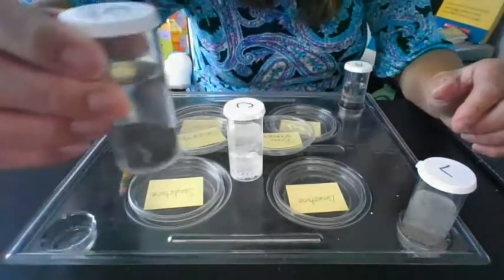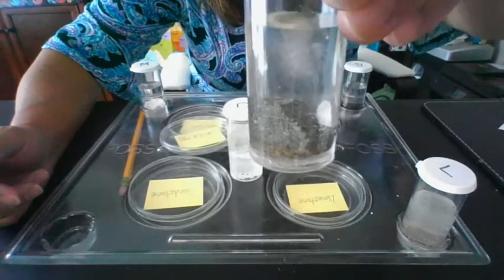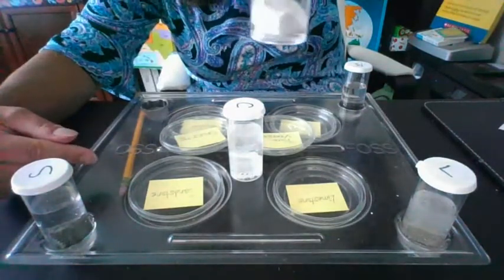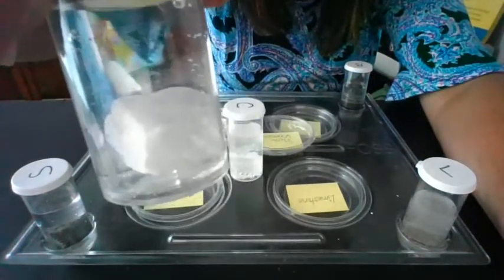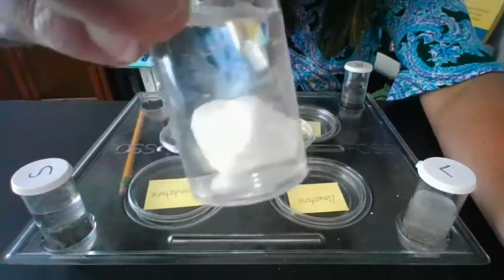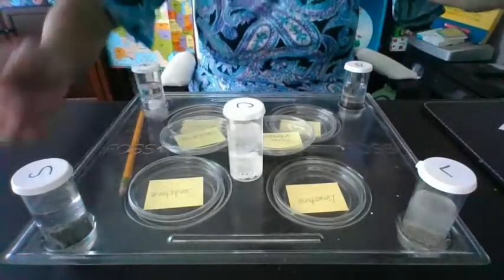And we initially thought we saw some stuff going on with sandstone, but now that it's settled some, there's really not much going on there with sandstone. Not much. But, my friends, take a look at this one. This is our marble. And is there a reaction going on in there? Marble? We thought maybe. So I'm going to put a question mark by sandstone and marble.